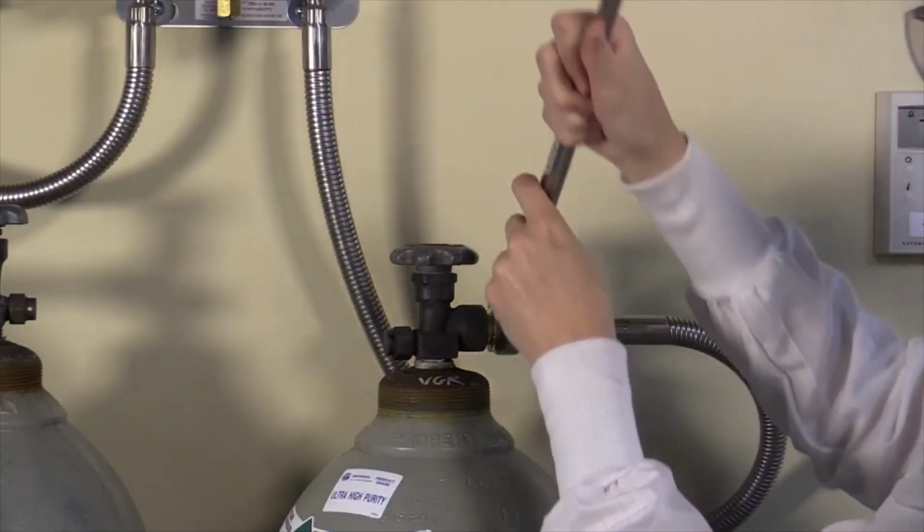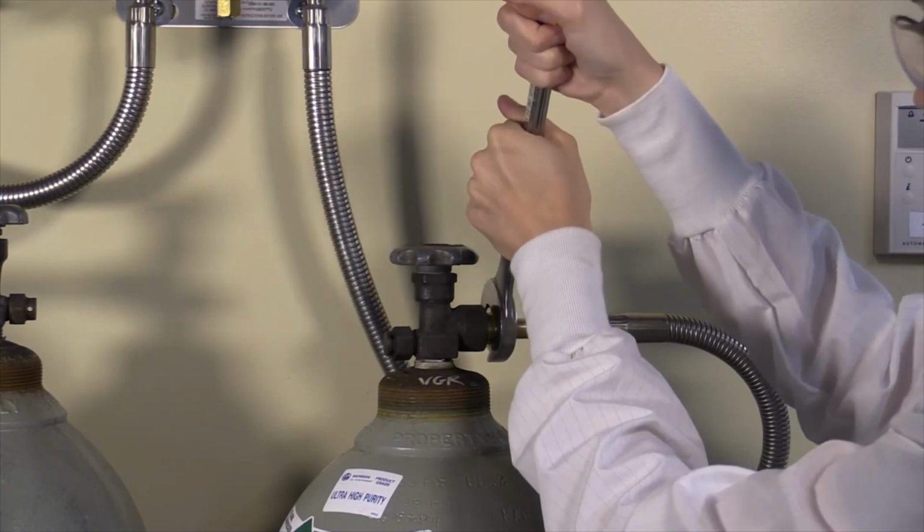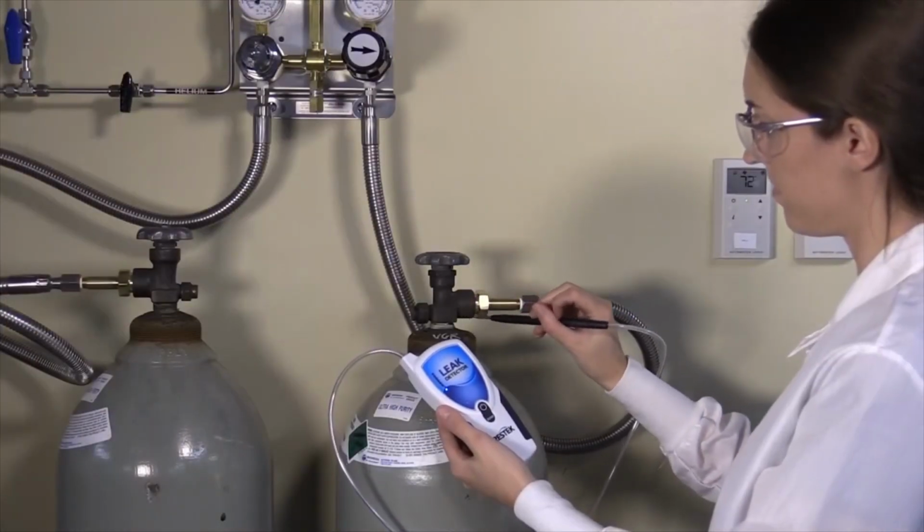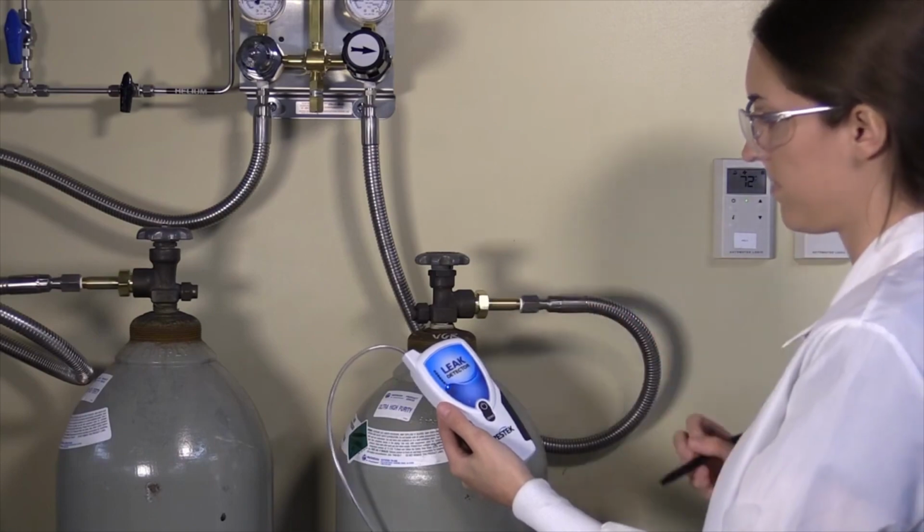Leaks aren't always immediately near your GC. After changing gas cylinders, you should also check around the regulator. Be sure to check any manifolds as well.